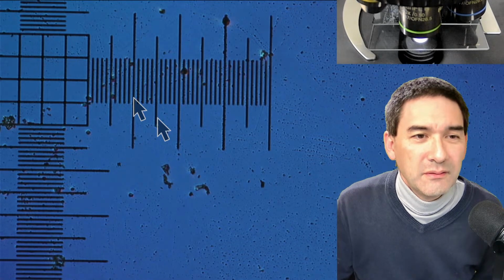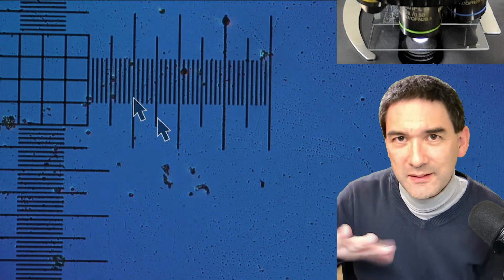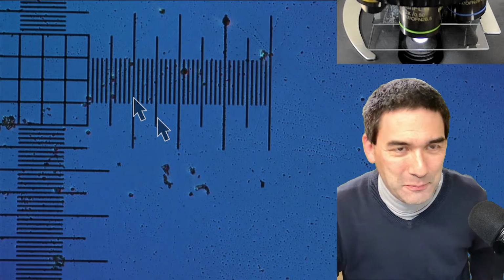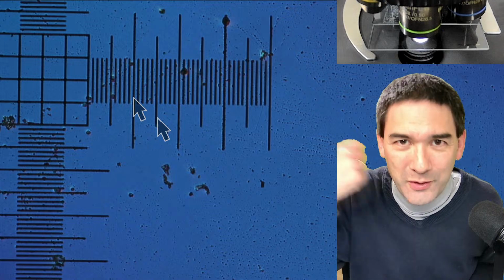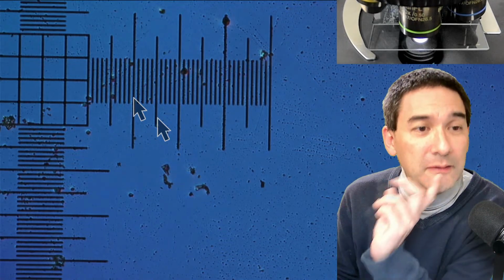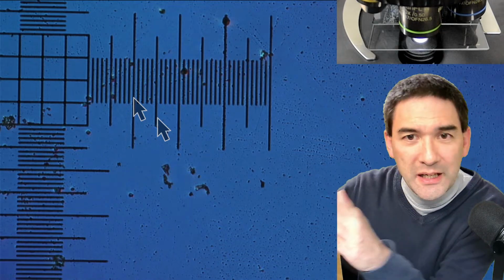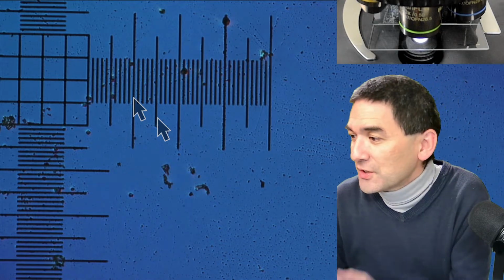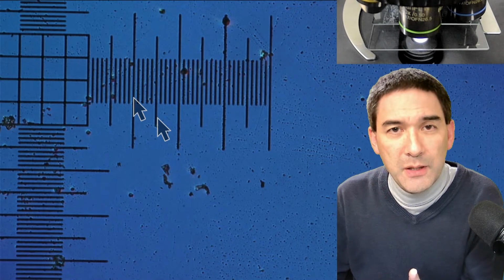Yeah, that's correct. But considering that the whole thing is not very precise anyway, because depending on how hard I push when I shave myself, the lengths vary a little bit. It would also be nice if you were able to rotate the stage. In any case, that is very briefly a measurement of my beard growth.